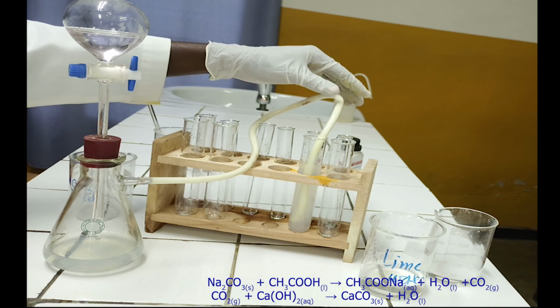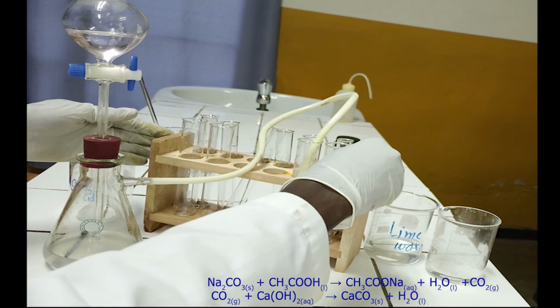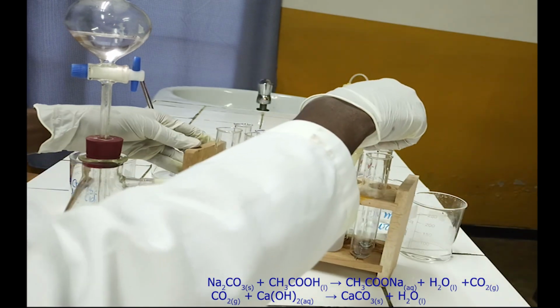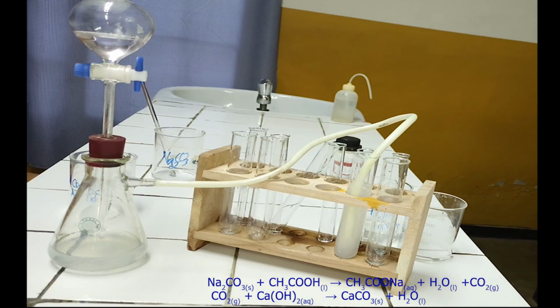Carboxylic acid is confirmed. Lime water is a solution of calcium hydroxide. It reacts with carbon dioxide to form calcium carbonate. The calcium carbonate is insoluble in water and it appears as a white precipitate. Below, there is the chemical equation for this reaction.